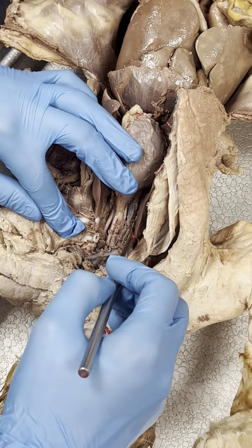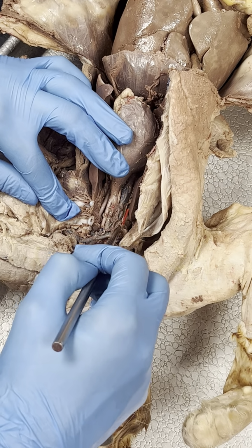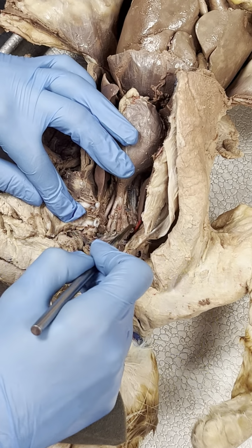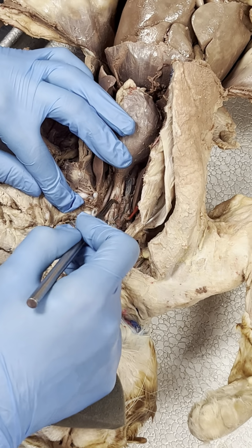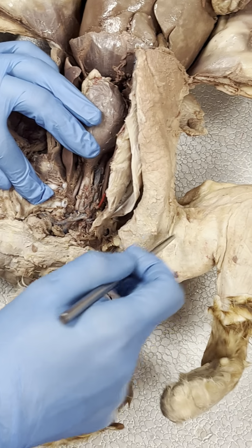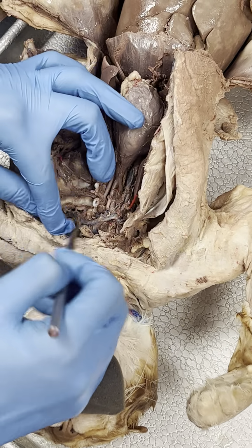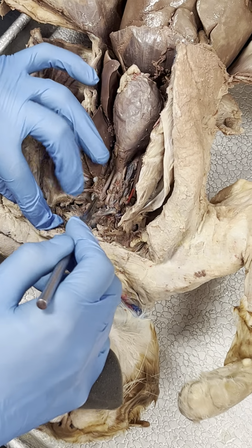Then if we push this to the side, they didn't really get the chance to clear off this shoulder, but that right subclavian is going to lead into the right axillary, and then once you get into the arm, that's the right brachial. It is cleared off on this side, so we'll go ahead and trace them here.